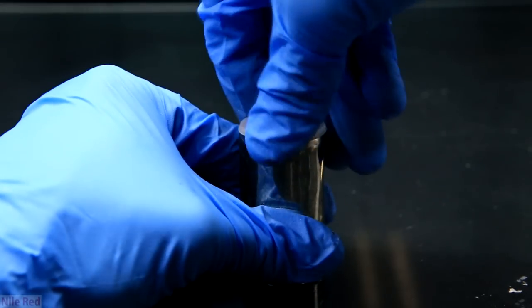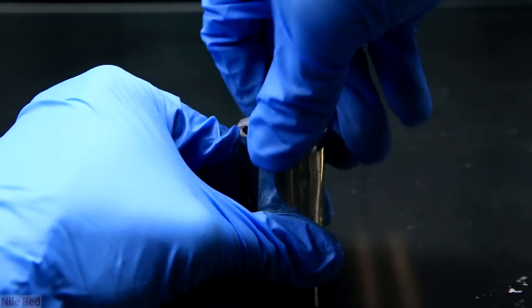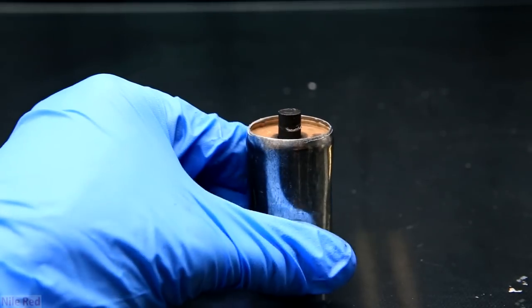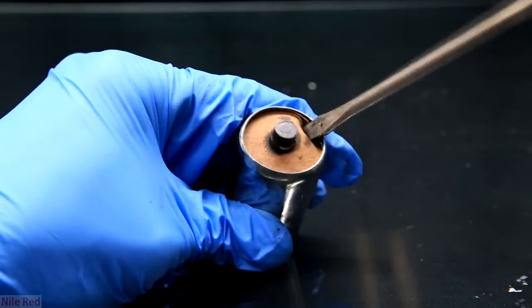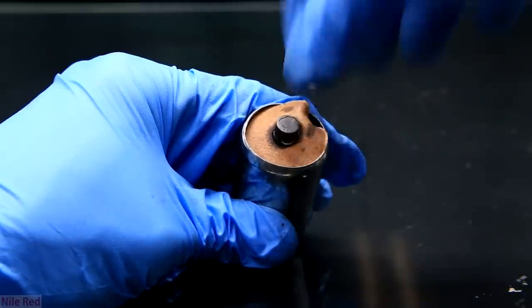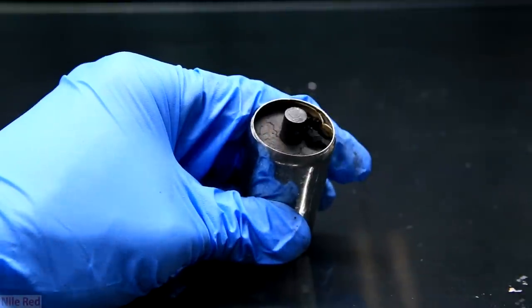At the top you can see the carbon electrode and the first thing we do is we tear off this plastic piece. When we look inside there's a little piece of cardboard and I remove this using a screwdriver. Once it's removed underneath we can see the manganese dioxide.